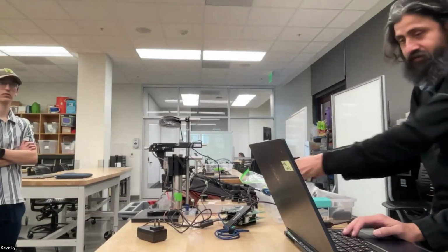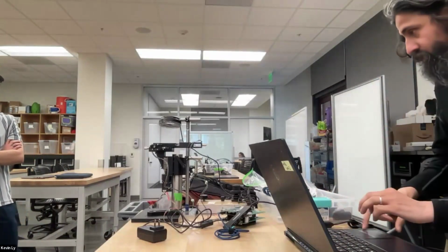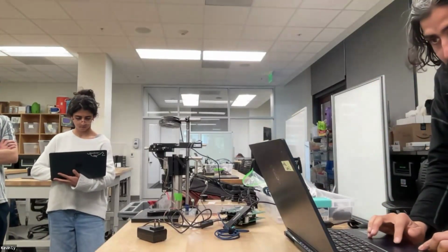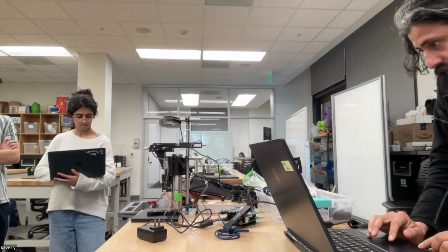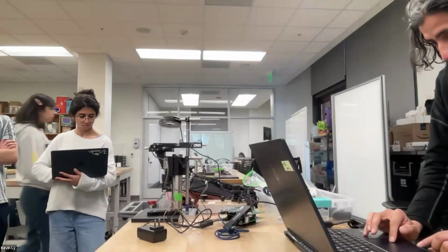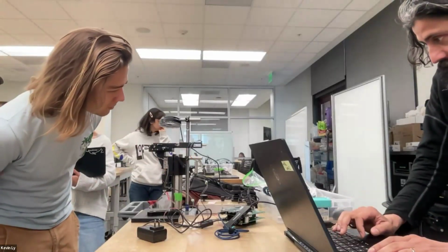you running the SQUID code yet? The main camera only. No. We want to run it fully. No. Maybe what Ben meant was connecting that to just that. For this, we should be running the SQUID. Let's try SQUID tracking. I think he said this one doesn't have tracking. Yeah, that's okay. I'll just see as long as it has. Is this the Raspberry Pi? Which other group has the Raspberry?